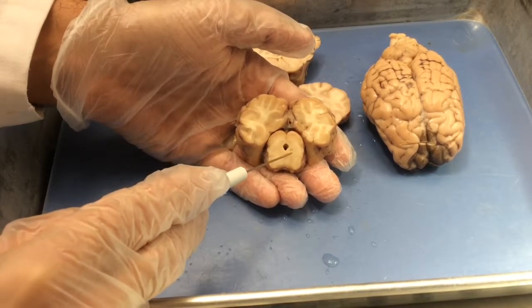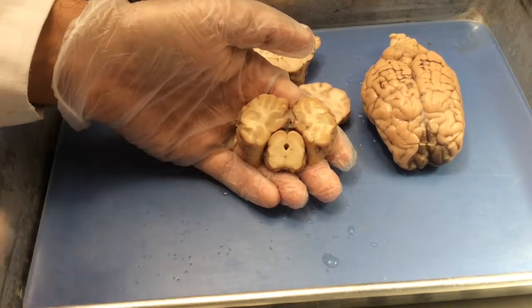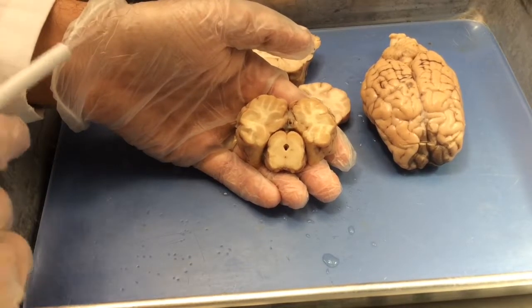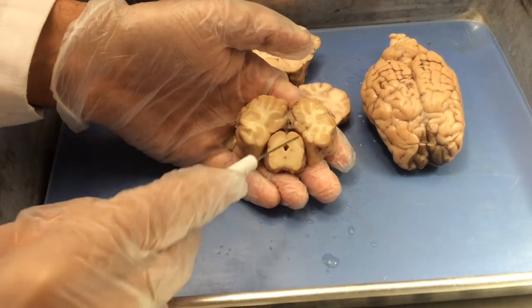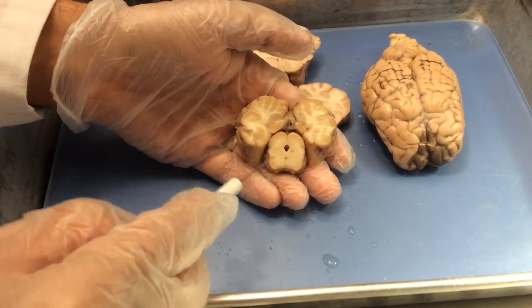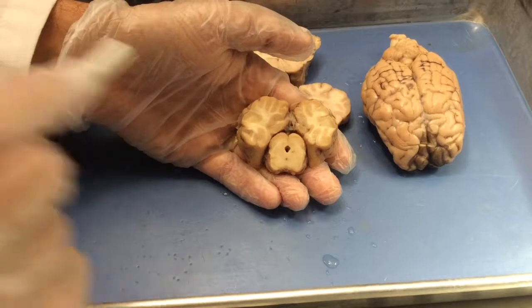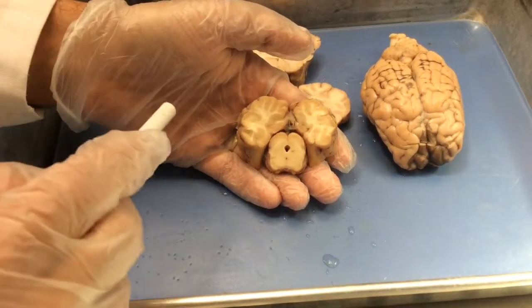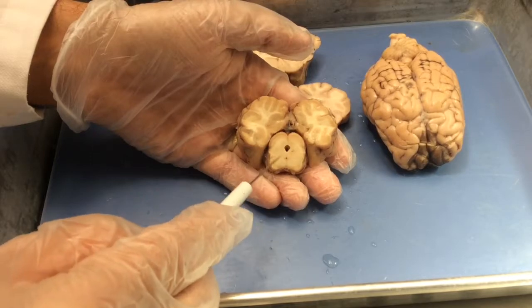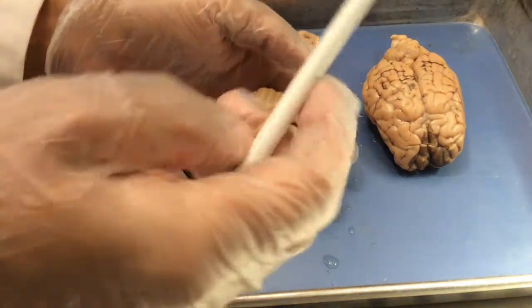The gray matter around the aqueduct is referred to as the periaqueductal gray, which just means the gray matter around the aqueduct. And then we have regions of the tegmentum or possibly pons on the bottom part of the section. It's difficult to identify from this angle. So occipital lobe, colliculi, cerebral aqueduct, periaqueductal gray.